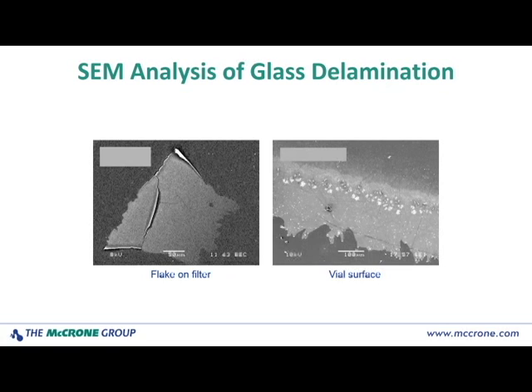On the left we see a delamination flake on a filter. It's been isolated on a filter, and then the filter and flake have been put onto a substrate for analysis in the scanning electron microscope. So the darker gray area that you see in the background is the substrate, the filter. The lighter gray angular feature that you see taking up most of the center of the image is a delamination flake, and you can actually see the edges curling up, so it gives you some idea of how thin these flakes are. Now, if these flakes become very small or are extremely thin, they don't impart a lot of contrast to the image, and they may be very difficult to locate in the SEM, which, as I'll show, is another advantage of going to the transmission electron microscope.